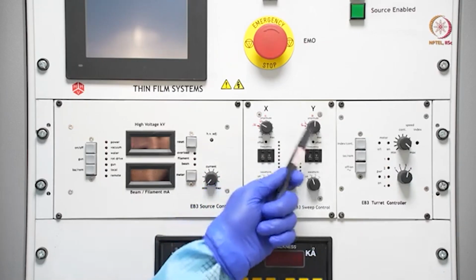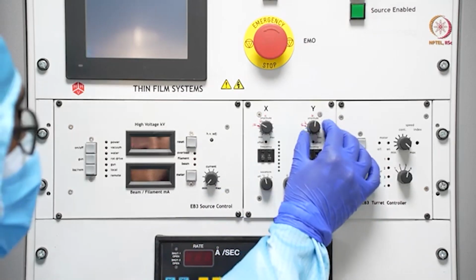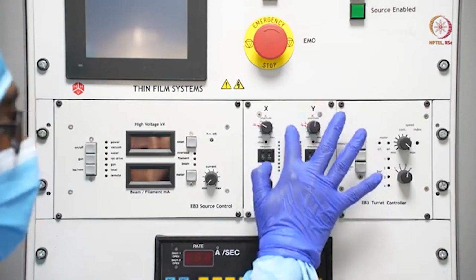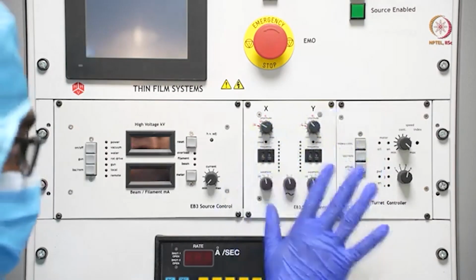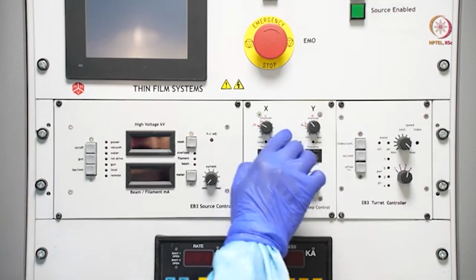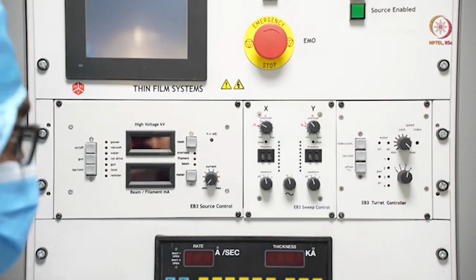And these two will be used to define the amplitude. If you increase the amplitude, it will take more area, and if you decrease the amplitude, it will take less area on the crucible. That can be controlled by these two. Here, in a closer shot, you can probably see that for platinum, titanium, and different materials, we have already noted the settings, but that optimization is tool specific, and you can do it for your tool as well.